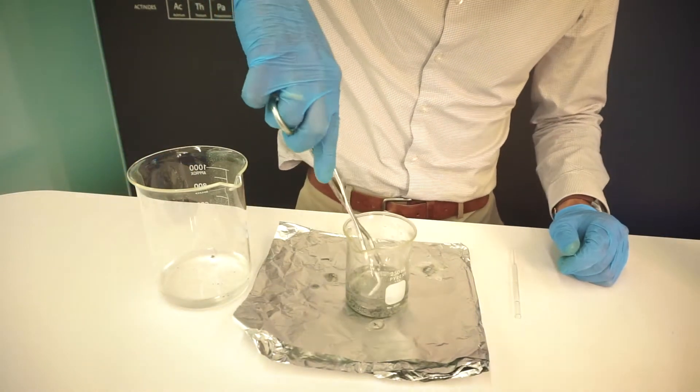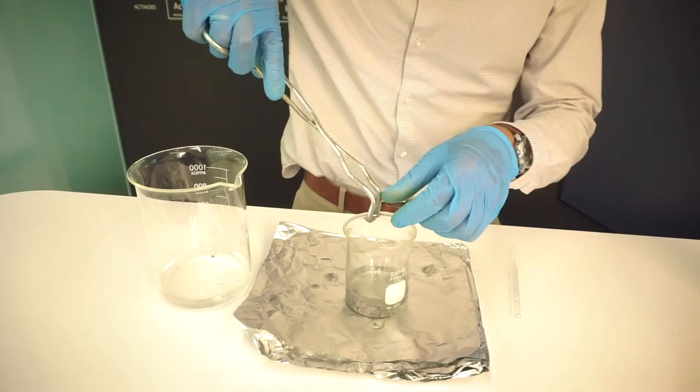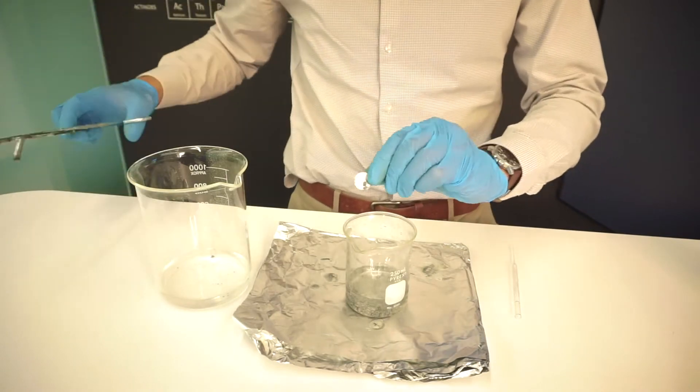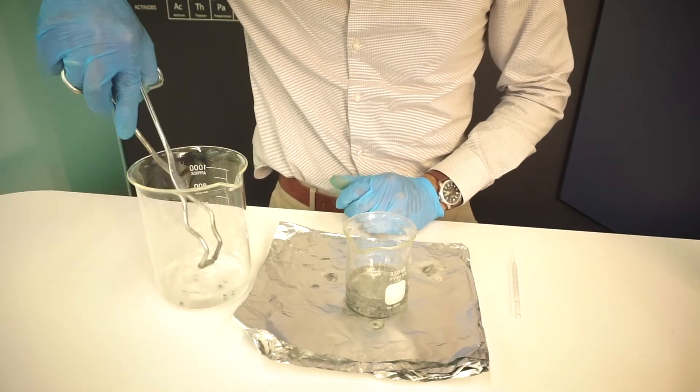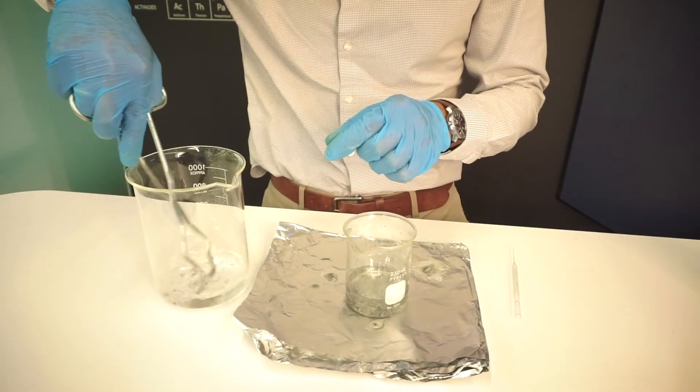So let's take it out of the solution and just rinse it a bit with water.